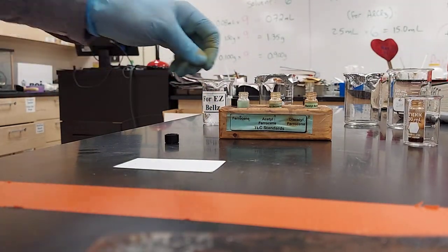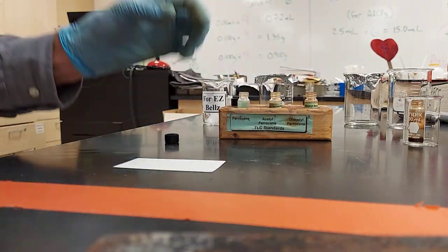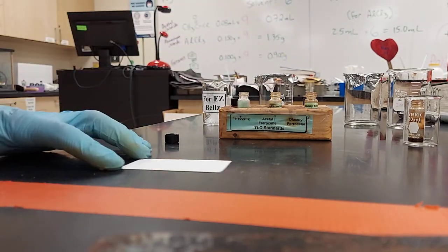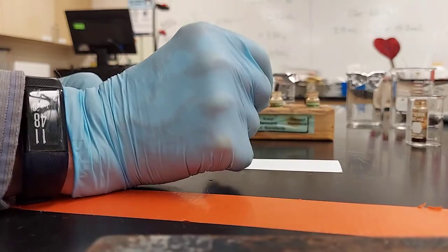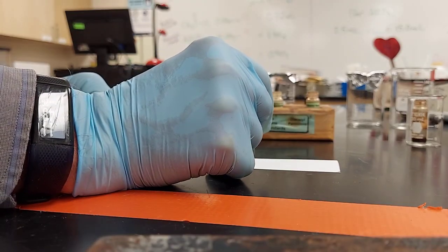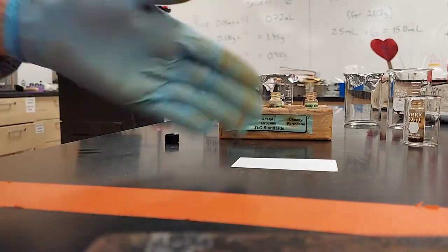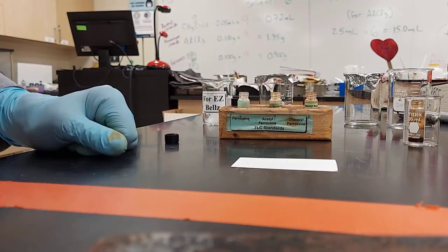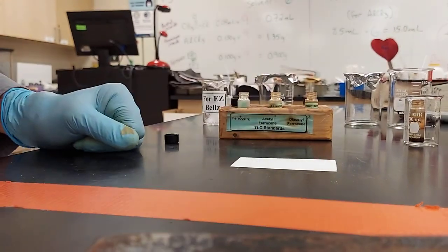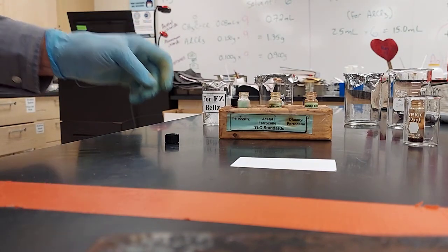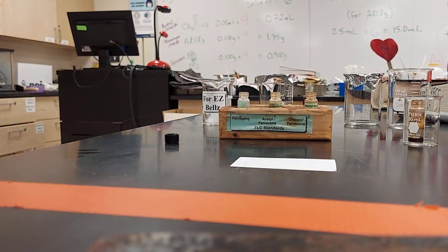So what you do, I'm going to show you one of the spots. You take it out, and you spot it once until it's wet. You let it evaporate, and you spot it again. And you're going to do that for all four.